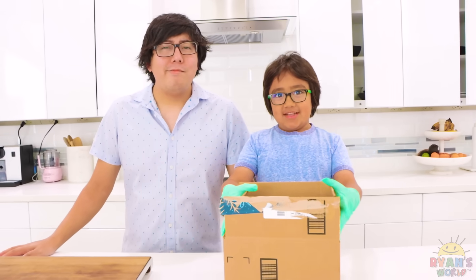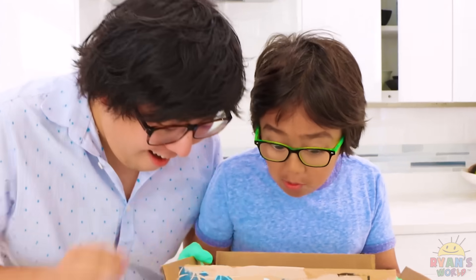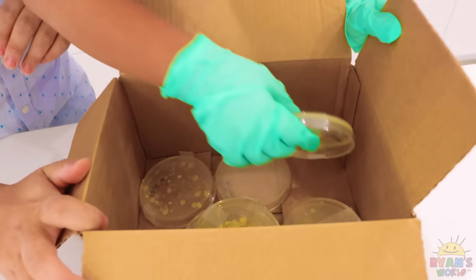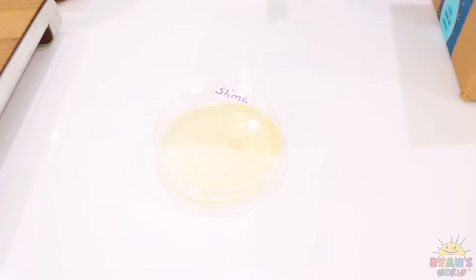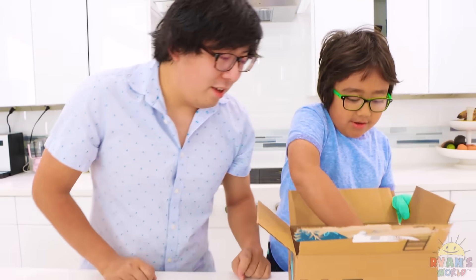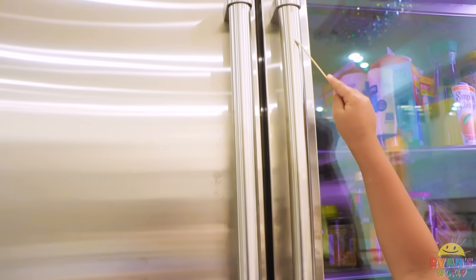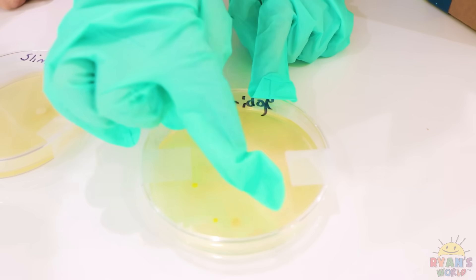It's been five days. Now let's see if there's bacteria. This is probably the best one — the slime. It barely has bacteria on it. Yeah, that's clean. The fridge is probably the second best because there's one here, one here, one here, one here, one here.